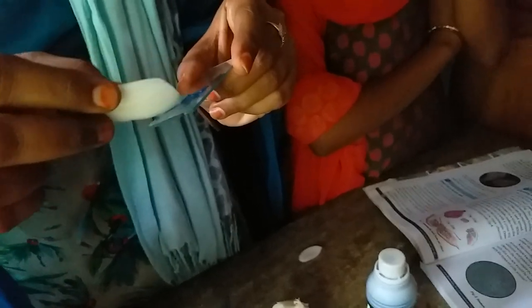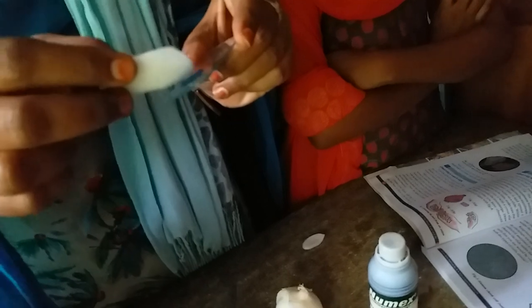We should be careful. The peels should not be folded.